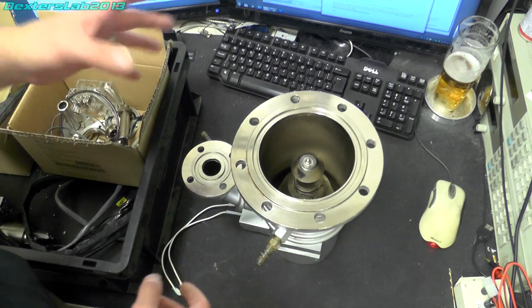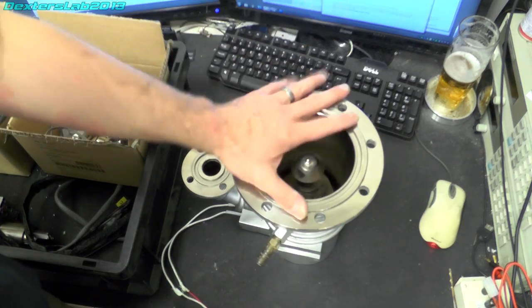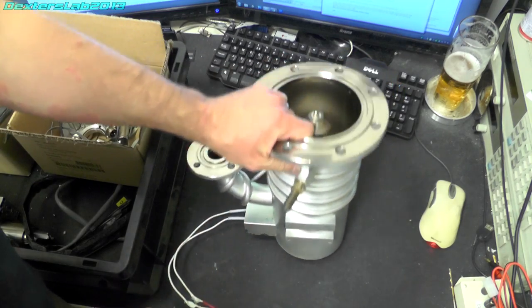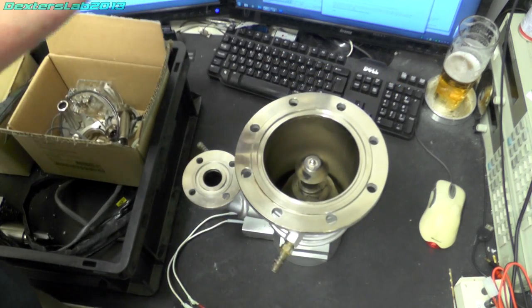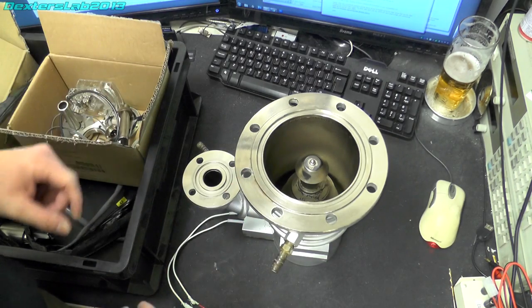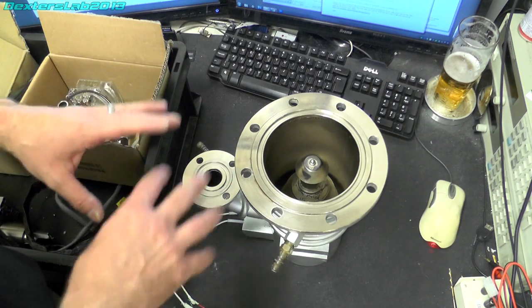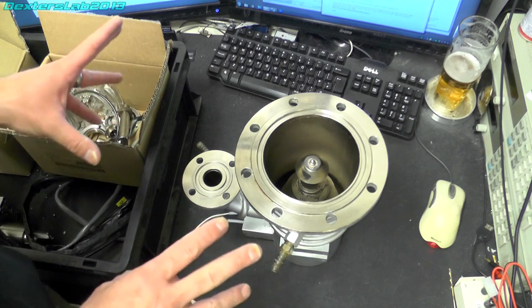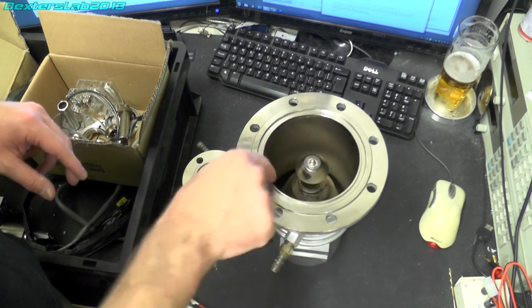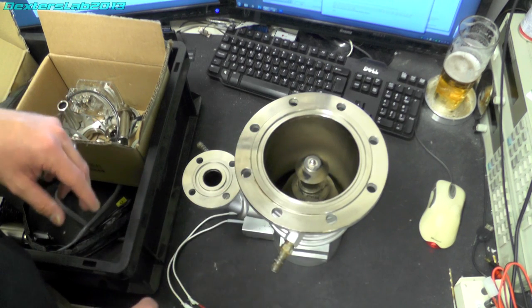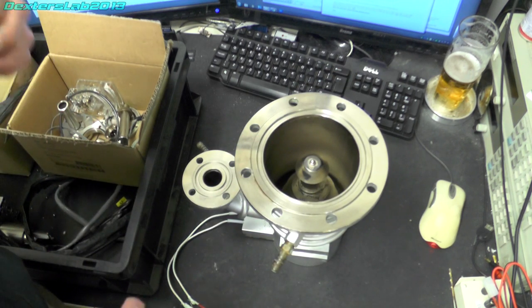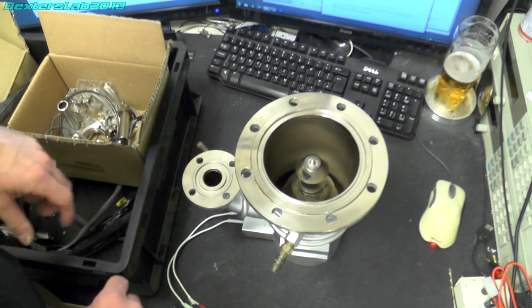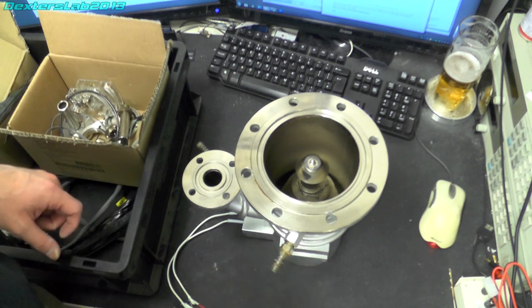And the last thing to see is the diffusion pump. I have obviously removed this because I'm going to be selling this on eBay. And I've also been cleaning it as well because it was in a pretty filthy condition when I took it out. The oil was completely black and completely burnt. And the Christmas tree inside was completely black. So it's going to take quite a long time to get that almost cleaned. There's still a little bit more to do.